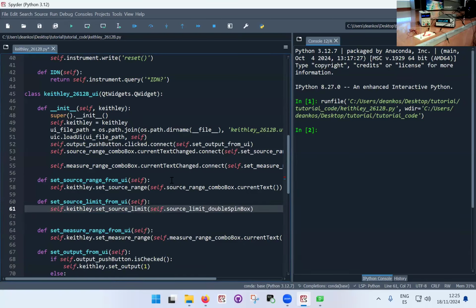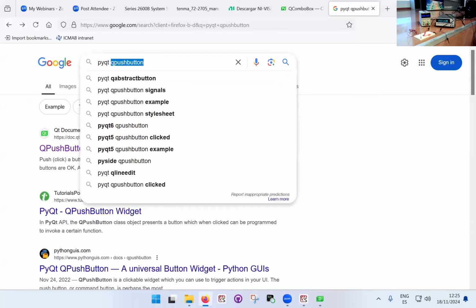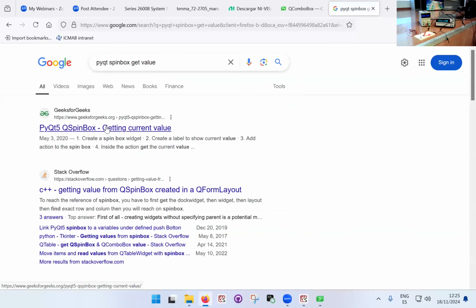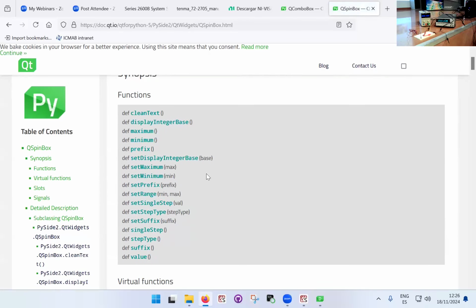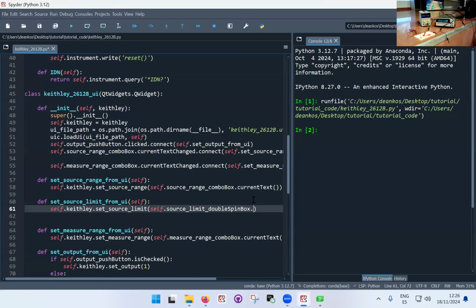And now from the spin box, I need to actually get the current value. This is something that I need to again look up in the documentation. PyQt spin box or double spin box get value. Generally, if you look up something like this, it will pop up. There is value. It's as simple as that. So I use this dot value function to get the value inside the spin box, and so that's all I need to do. Dot value.